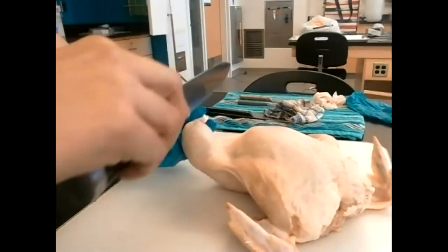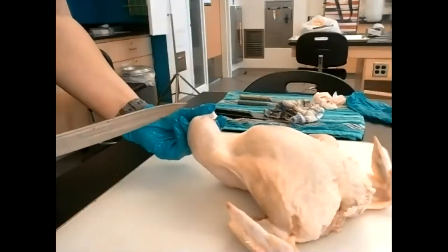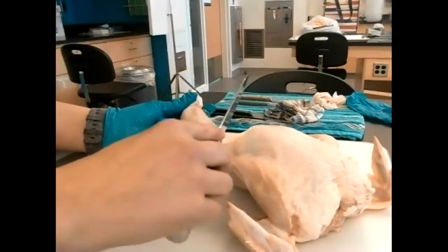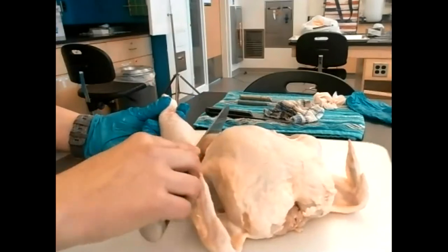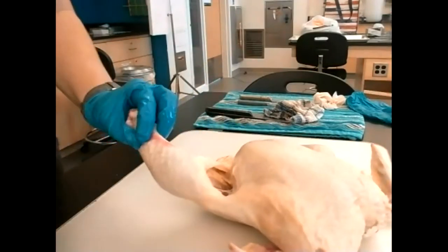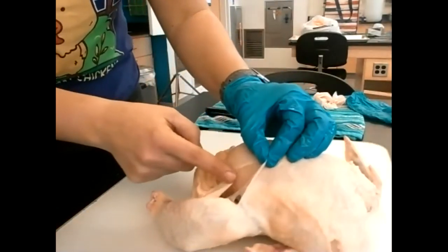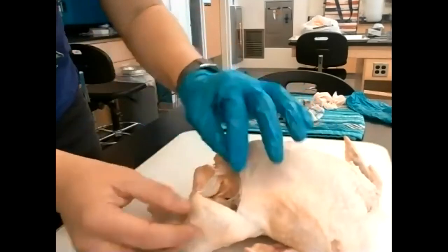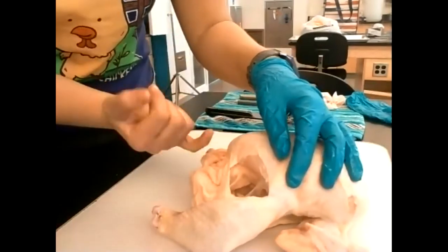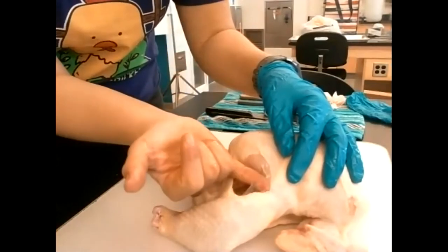In general, you want slow movements with moderate pressure. You don't want to hack away — that will wreck the tissue. Just drag the knife across the skin. What we can see already is the white breast meat exposed. We're also starting to see some fascia.